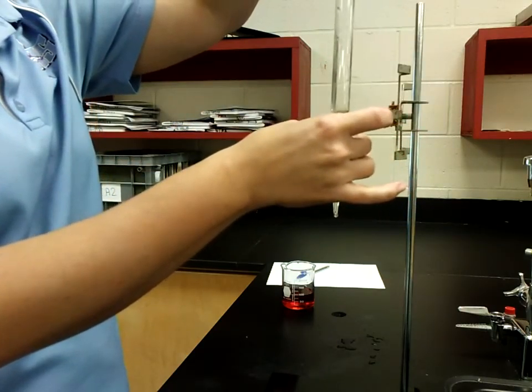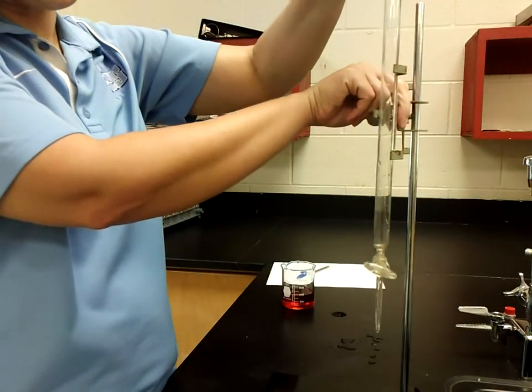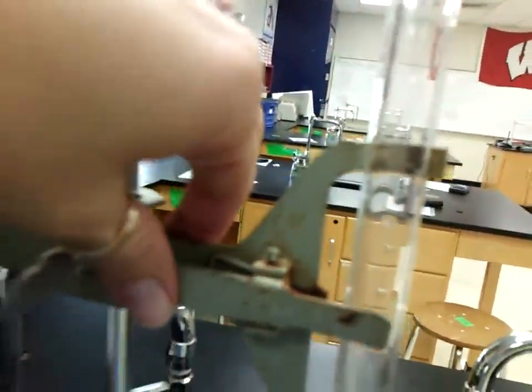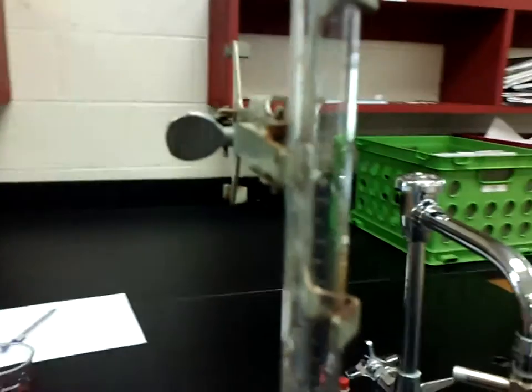So notice how I just clipped it in here, I use this little bar right here that holds it, and then it goes through the side, so you have it supported on top, on the bottom, and through the middle.